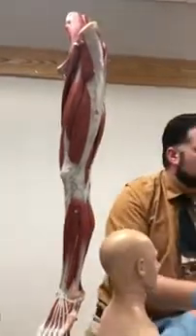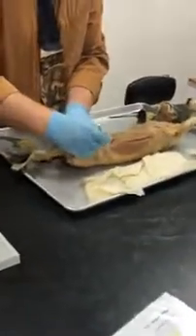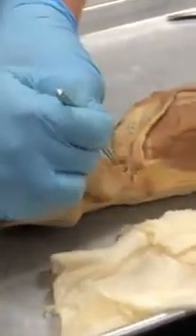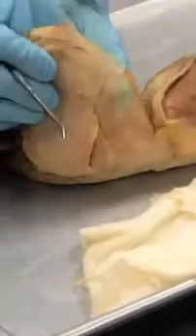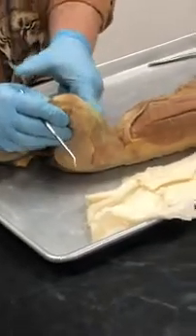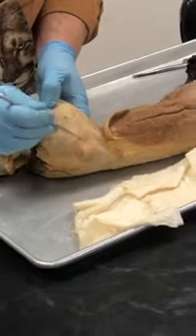So let's find them on here. Same place. What you have over here is this muscle here. See it? What's that muscle there? 3 words. Tensor fascia lata. Okay? Then you have this wonderful band here that my finger's behind. What is that? Iliotibial tract. Then you have a muscle over here.